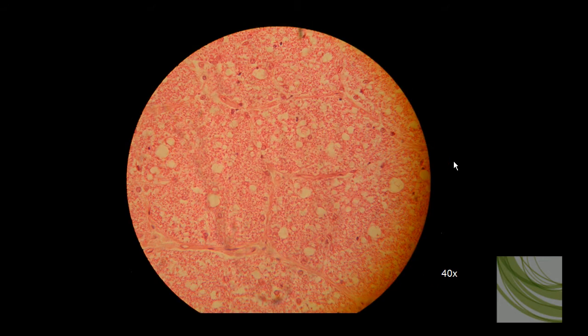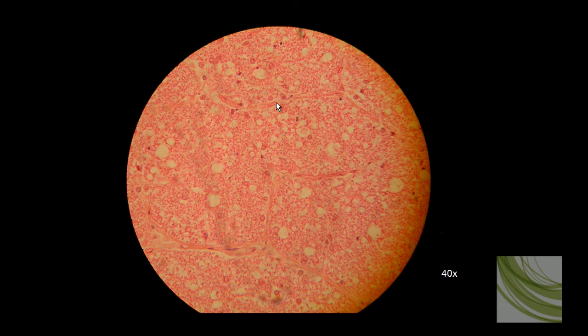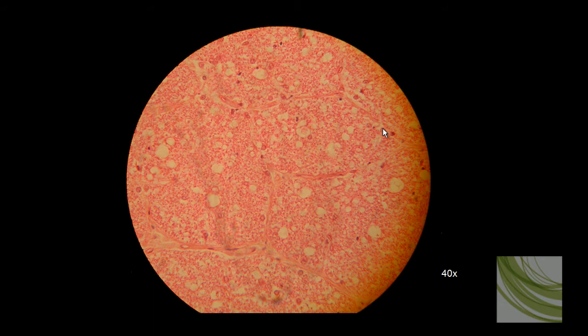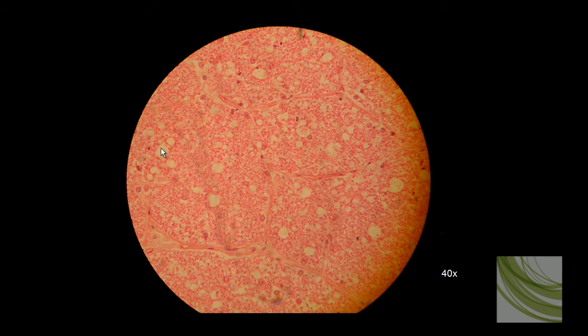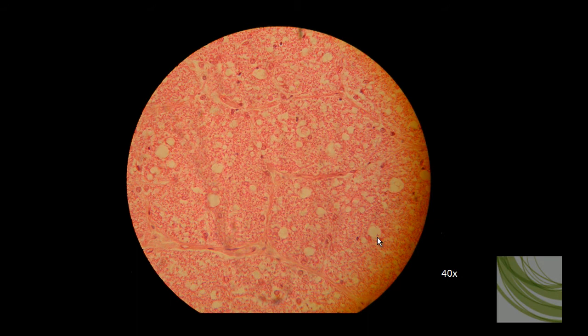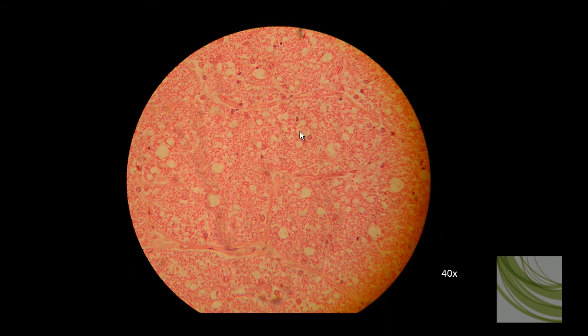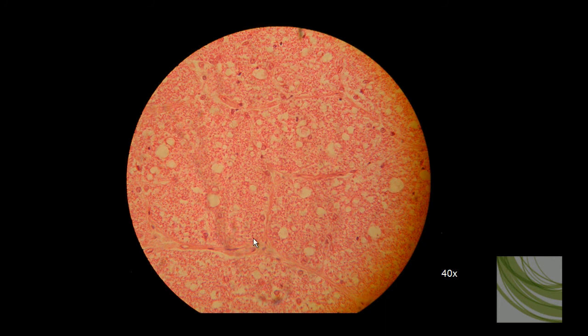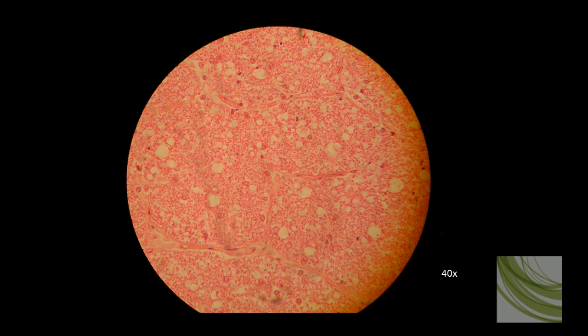Here is that same slide at the 40x objective, and it actually has some benefit — it's not too bad at this magnification. We can see some perineurium and a lot of individual myelinated axons. Remember, myelin is fat and fat doesn't stain very well. Inside some of these endoneuriums we can actually see some axon left over where it would normally be wrapped. We can see several examples of those, and we can see some little unmyelinated axons mixed in as well. This wraps up our review of two slides of cross sections of a nerve.